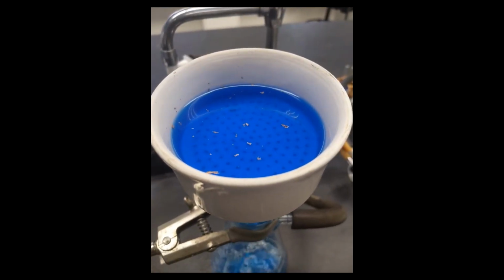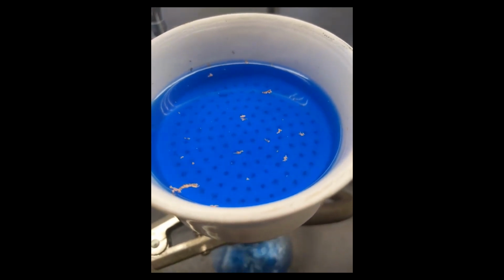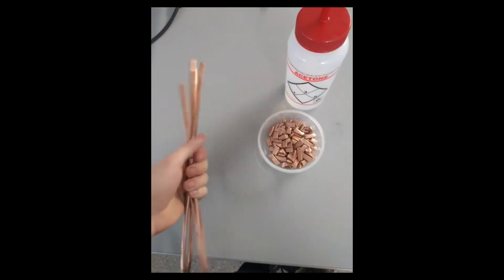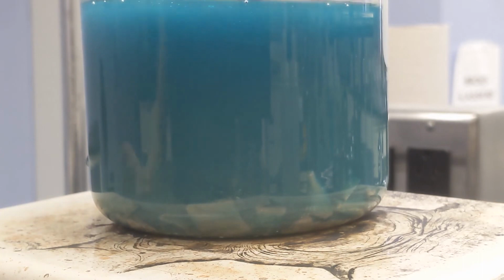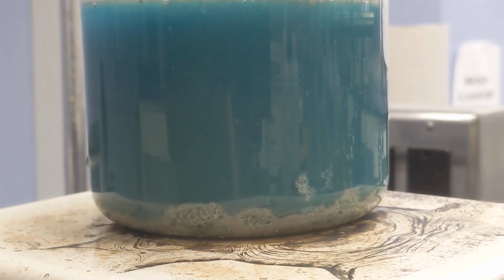So again, that's where all of this liquid came from, not from one little coin, but from a bunch of them, along with some junk that my dad gave me. That's what these floating doohickeys are from. We can just filter it off and then add our copper in full scale. And if you have any foresight for this kind of thing, maybe you can guess why using hundreds of little small pieces of copper is actually not such a great idea.